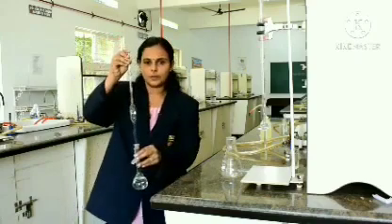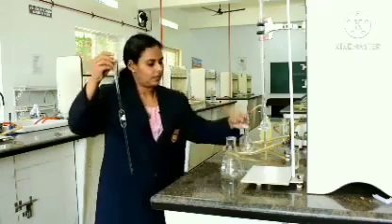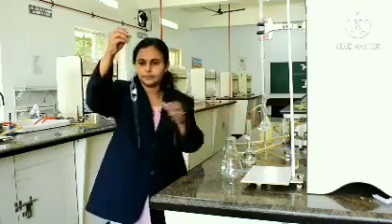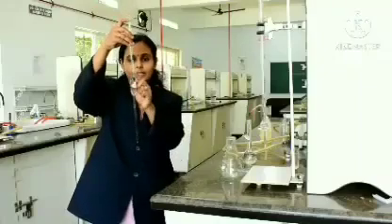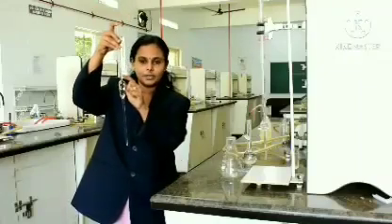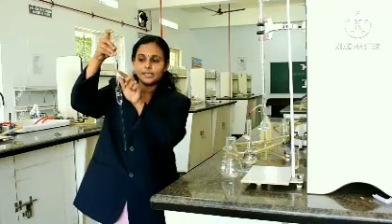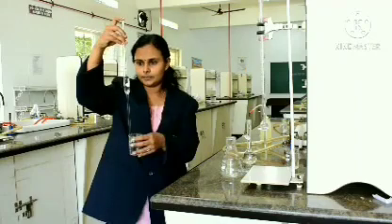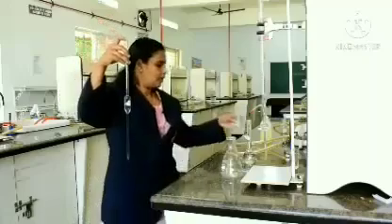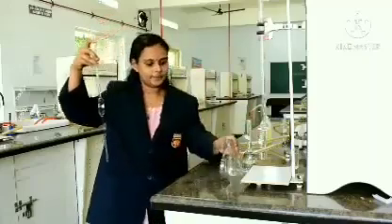So, once you stop here with the finger, it closes. Now, I have taken a little bit more than the line. Even for the pipette, as I said, it has got a mark. So, you have to see that the lower meniscus should touch the mark. Now, once the lower meniscus touches the mark, hold it tightly.